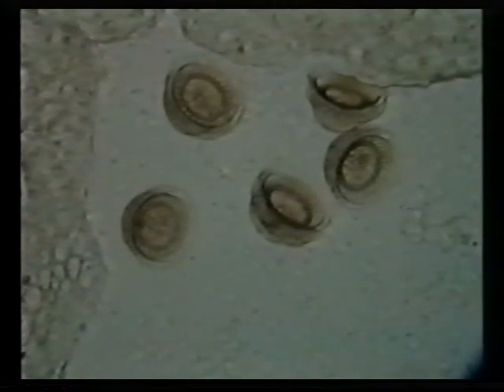Our usual view through the microscope gives us the impression that it is a flat disc. However, viewed from a different angle as seen here, clearly shows its true shape, as what can only be described as a flying saucer, the dome shape being quite prominent. Its mobility is also quite pronounced, as it glides from side to side.